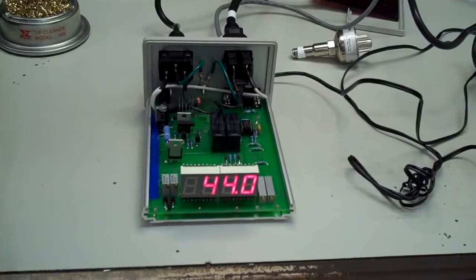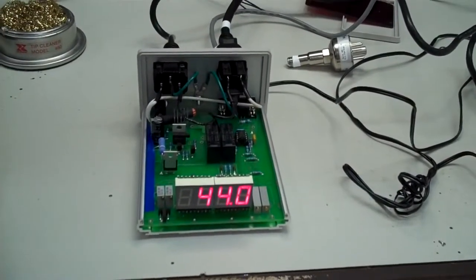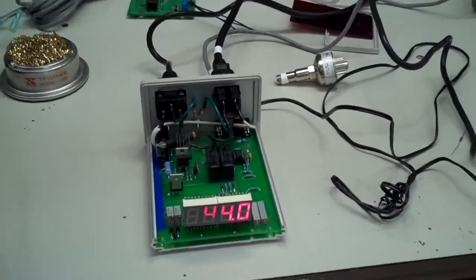This is a very simple way to control the vacuum level by turning on and off the pump. It is. Thank you very much.